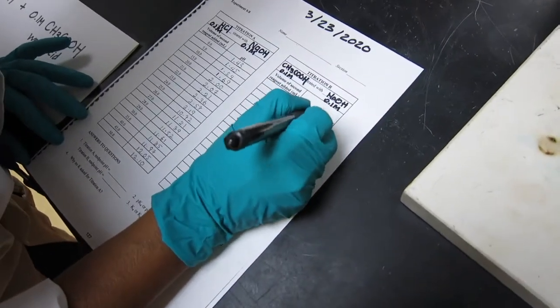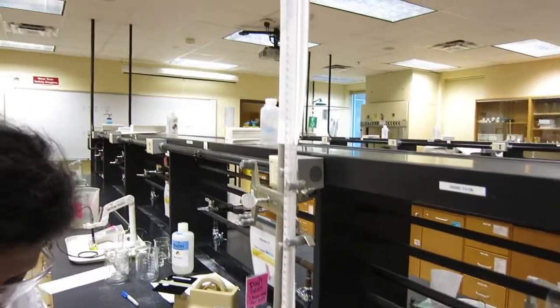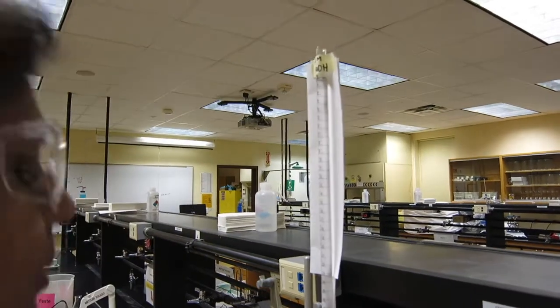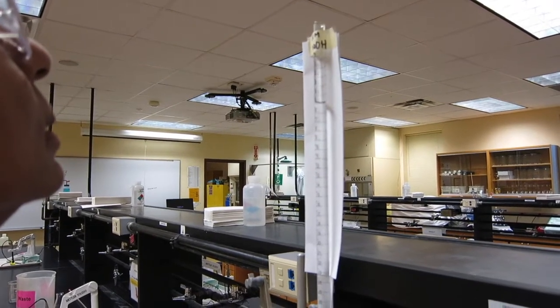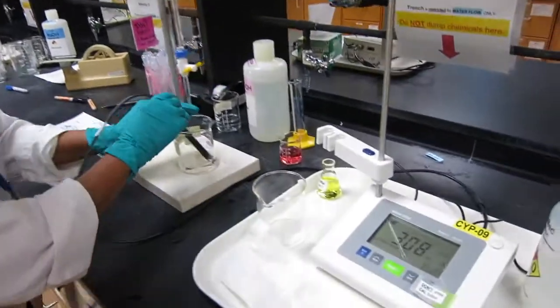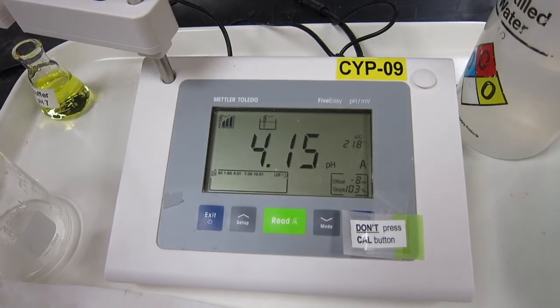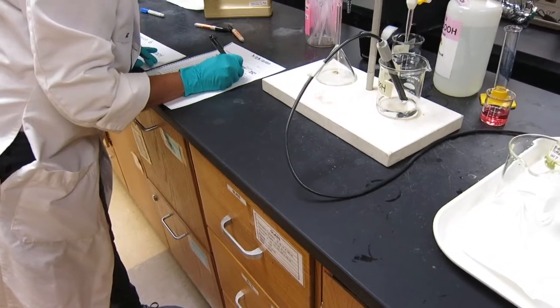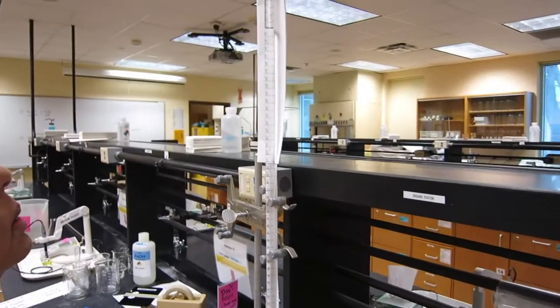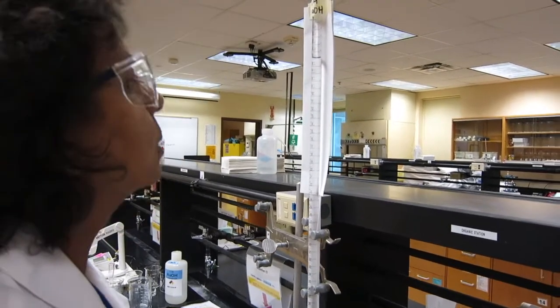The initial pH reading is 3.08 — we'll record that in the form. Now we're going to dispense 5 mL, for a total of 10 mL of NaOH going in.